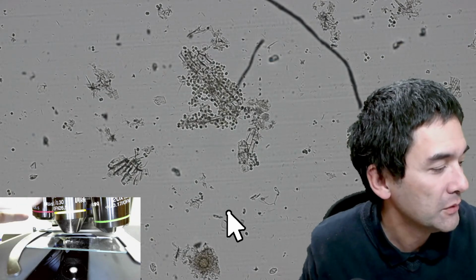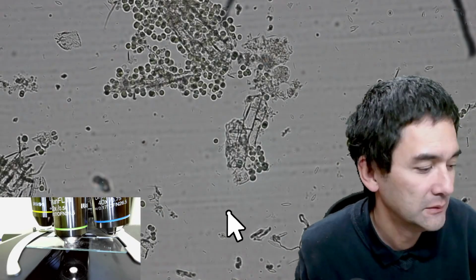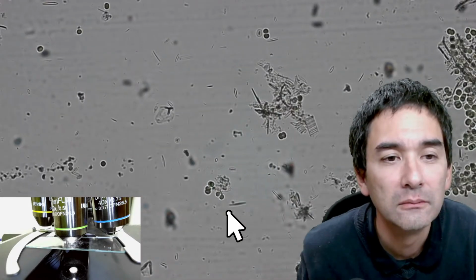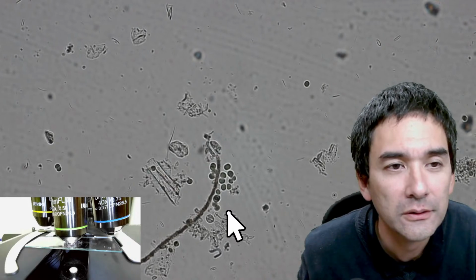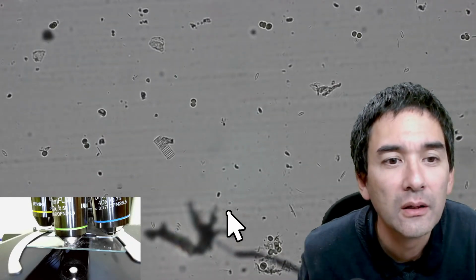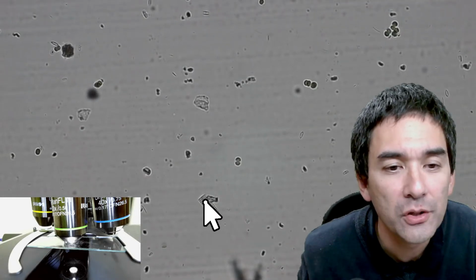Okay. So this is now the 10 times. This is now 20 times. I don't see any movement here. Maybe the sample is too old. I wonder what those round things are. It doesn't really matter. I just want to demonstrate. Here's some diatoms. Yeah, could be some diatoms here.